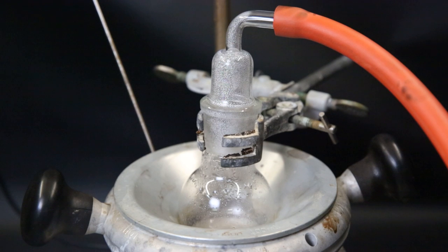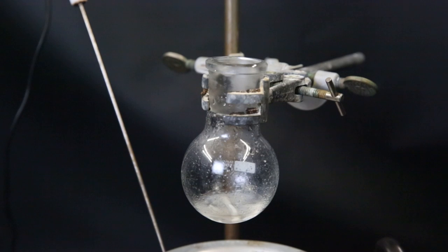After a while, all of the acetone is gone and only some water vapors are condensing in the flask. So I remove the vacuum and take it off heat.